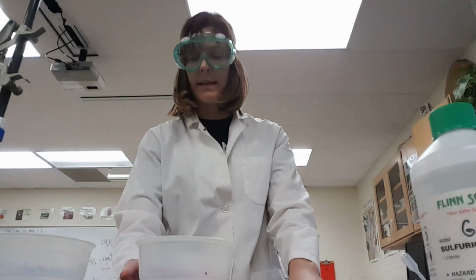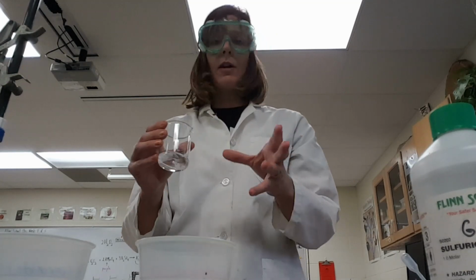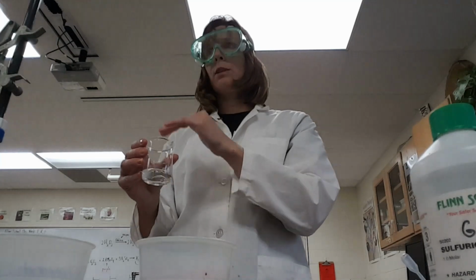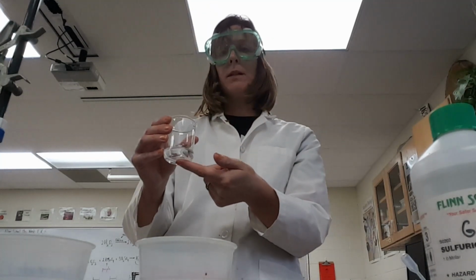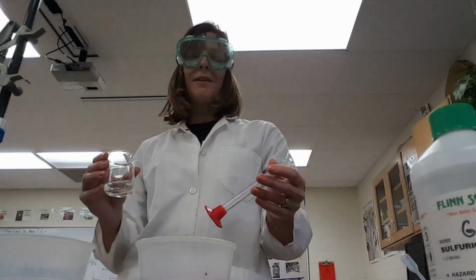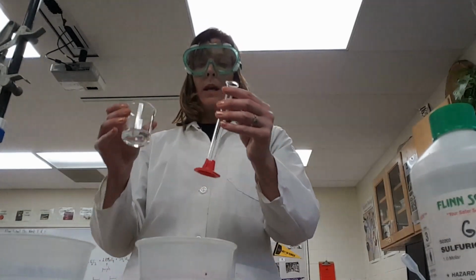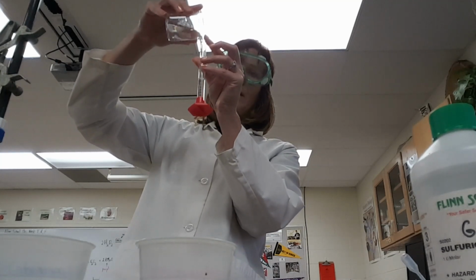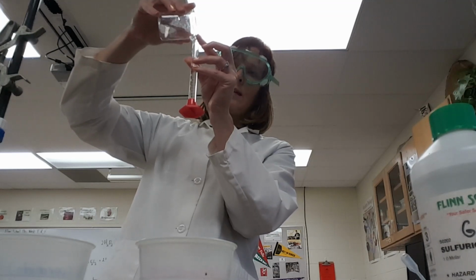Okay, so we've got some liquid in here now. It's actually 21 milliliters. We're going to do a step that is called the transfer step. This is actually more than we need to do for our titration. We're going to reduce the amount of potassium permanganate that we use by only using 10 milliliters of this at a time. Plus, that also gives you a second shot. So if you screw up the first titration, you'll still have 11 milliliters left so that you can do a second one. So I'm going to use my graduated cylinder to very carefully measure out 10 milliliters of this mixture.